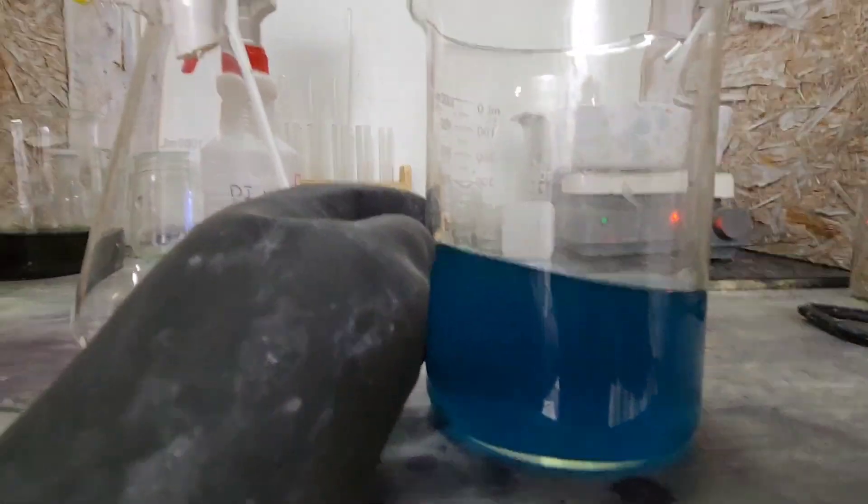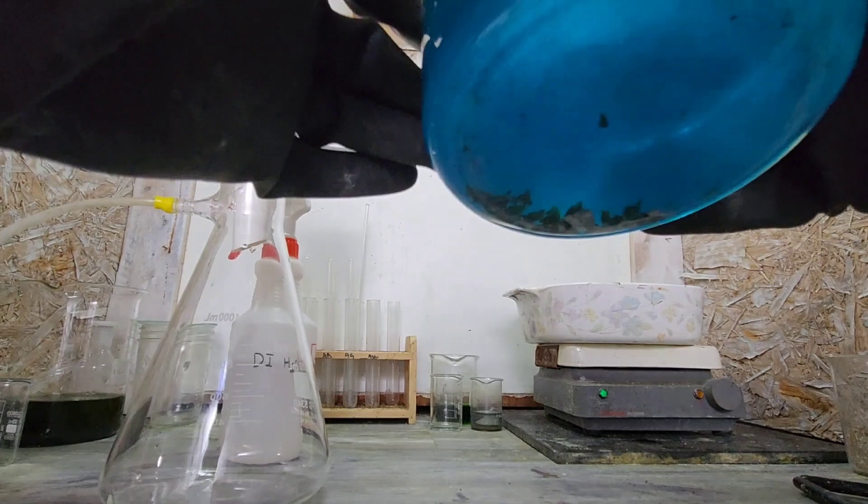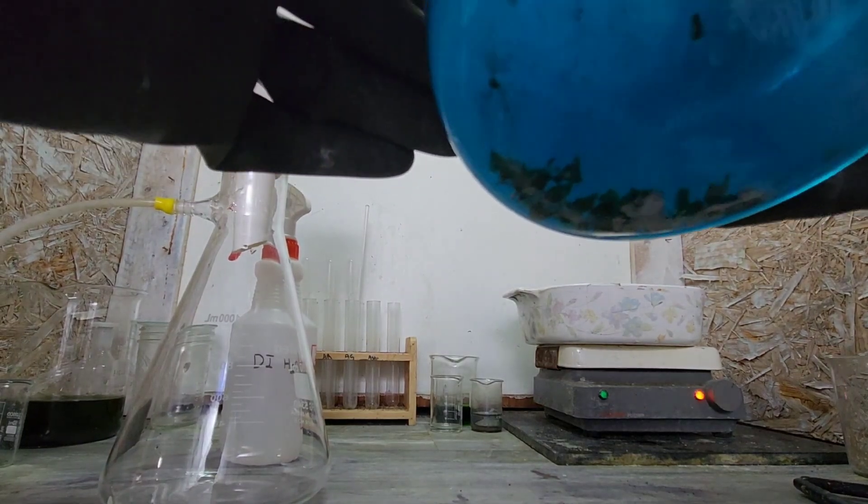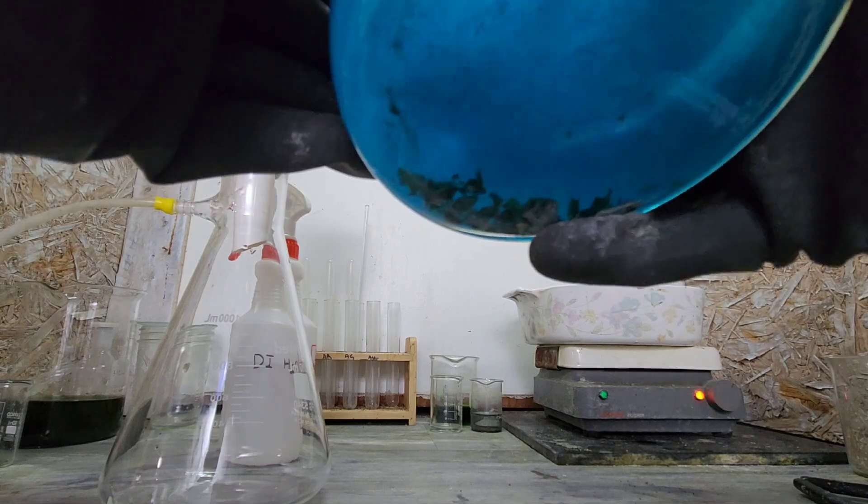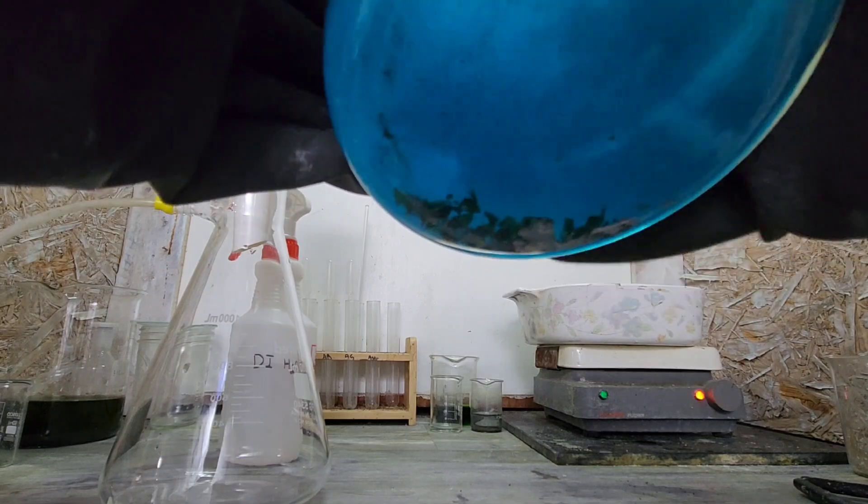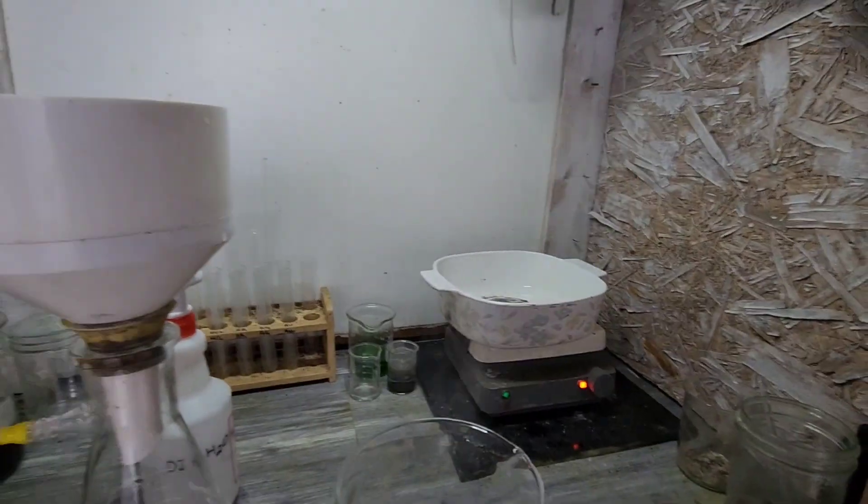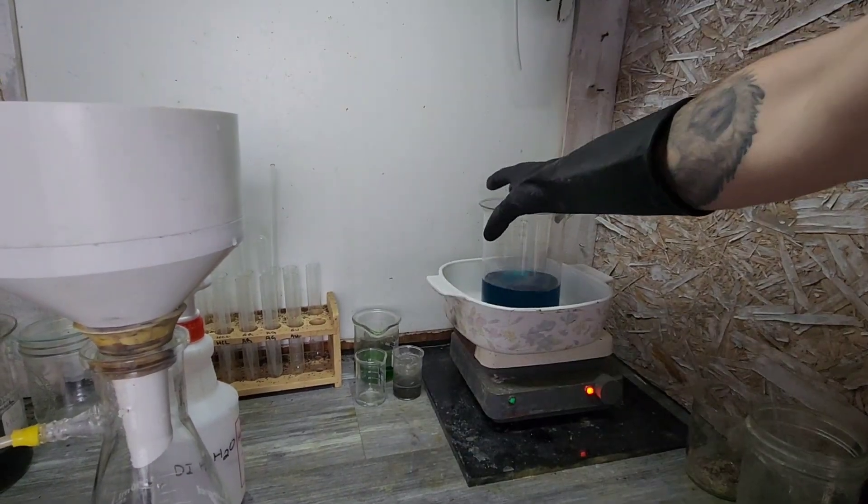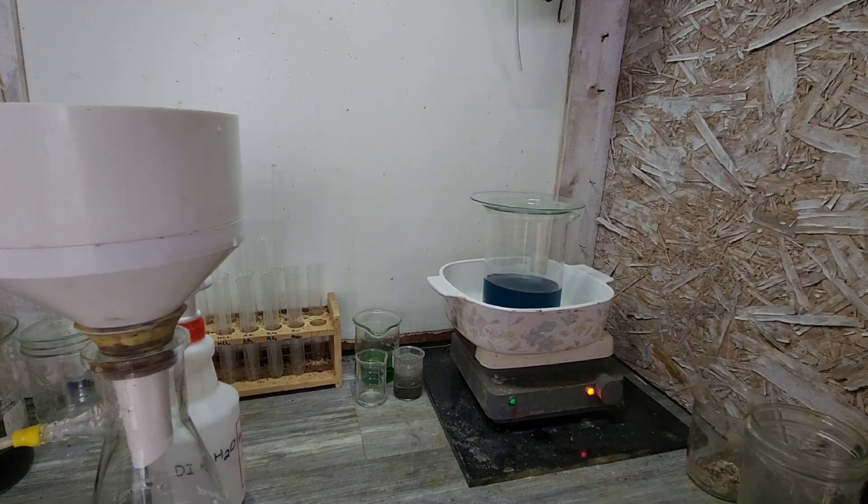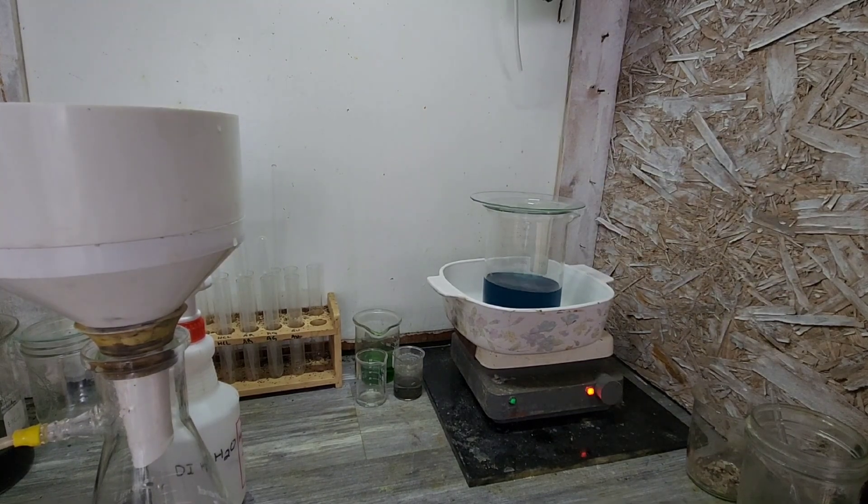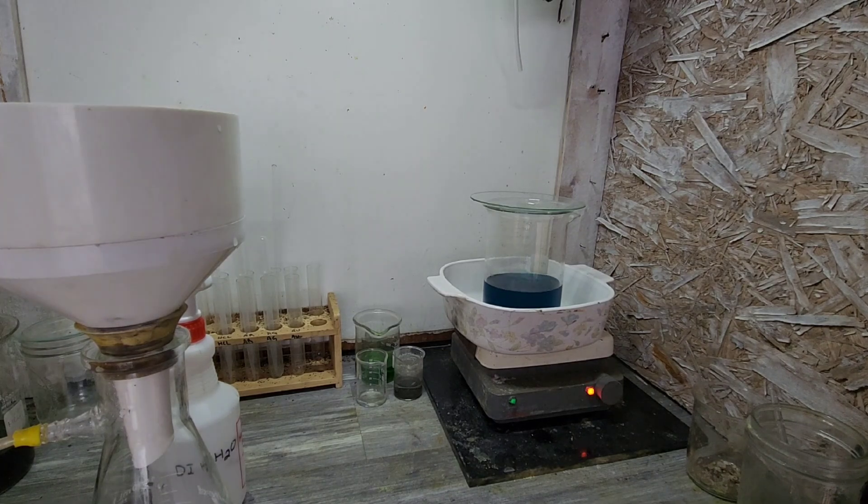Hold on, hold on. I think we got some silver. I see reaction. So we can definitely see the green, especially held up like this. So like over by my pinky here and here, we got a little silver left. So let's let it eat the rest of that up. Can't imagine it'll take too much longer. Hopefully we've got just the right amount of nitric in there for us to drive the rest of that silver in solution.